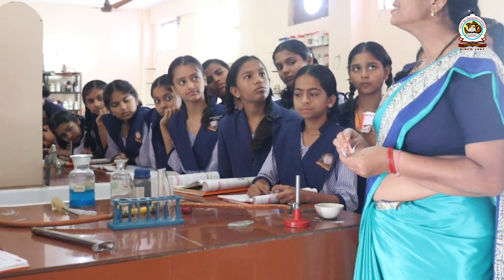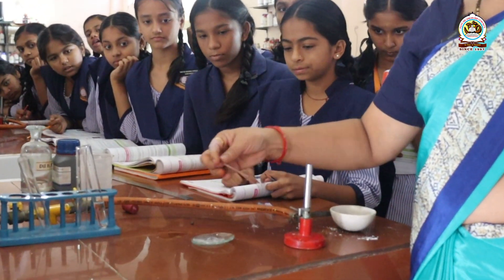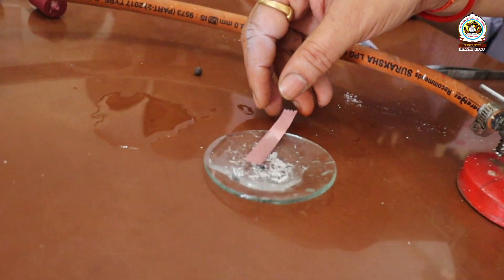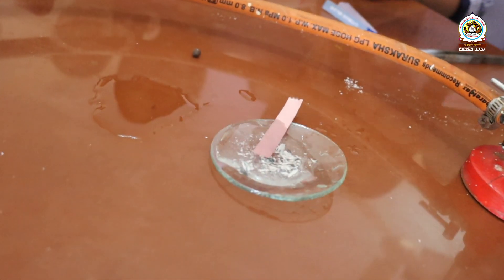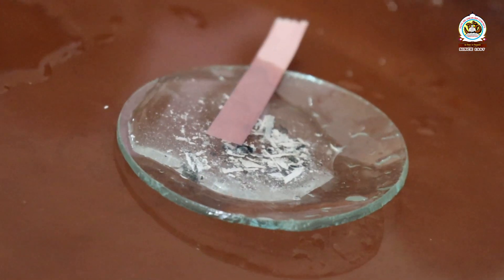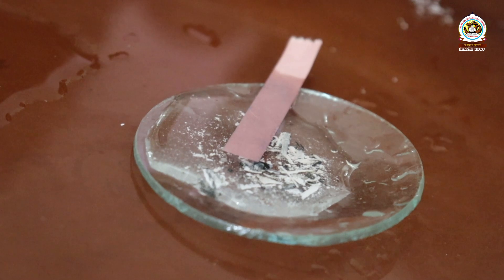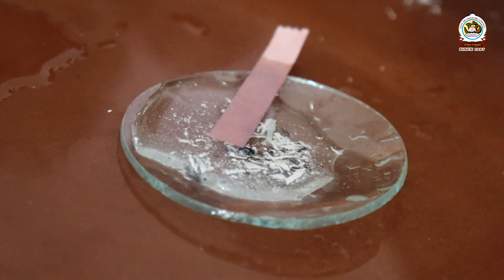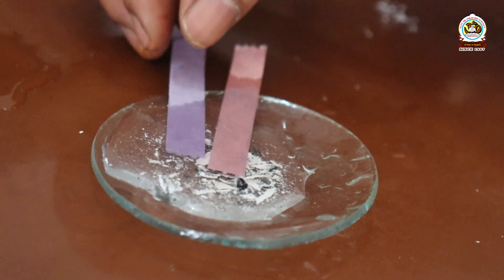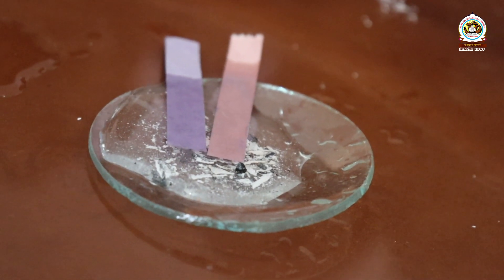I will dip a strip of red litmus paper in this solution, and then the strip of blue litmus paper. Leave it for some time.